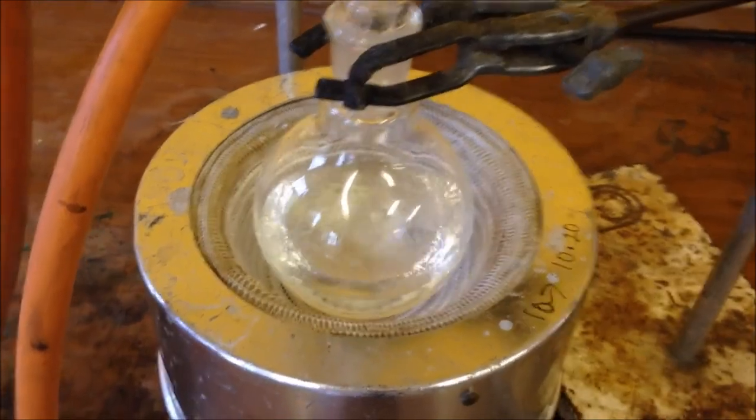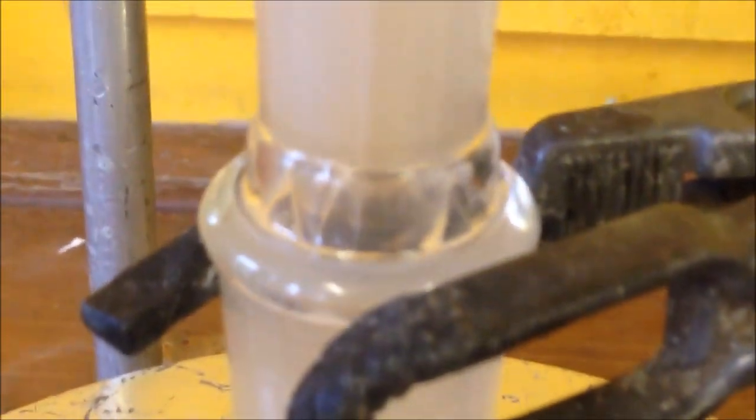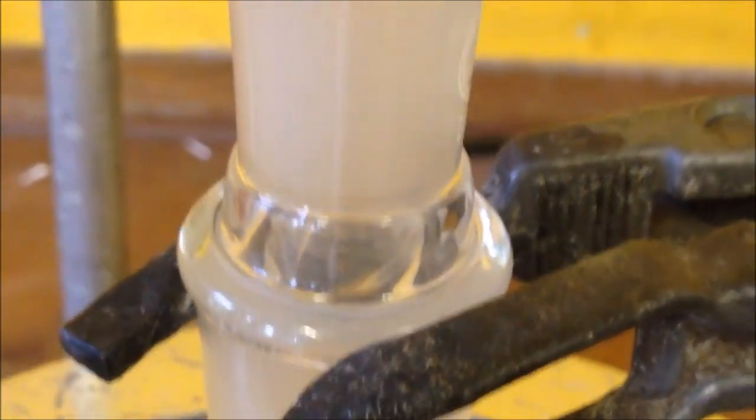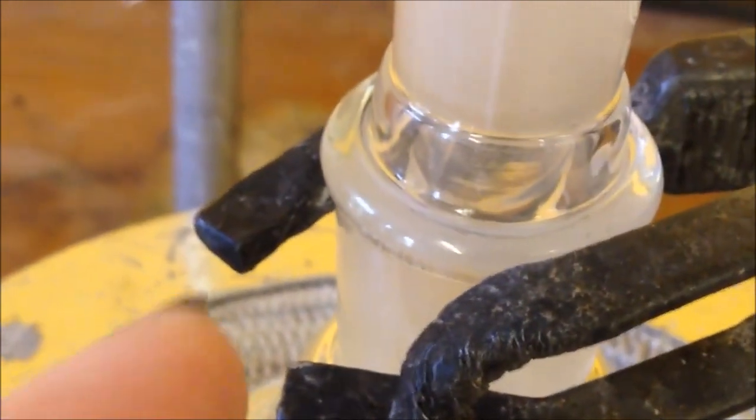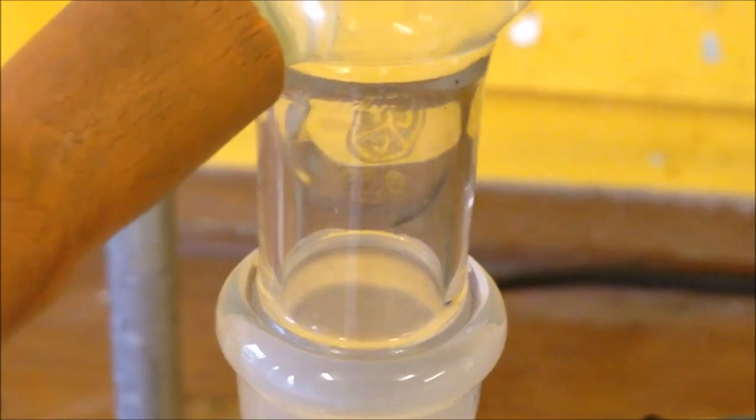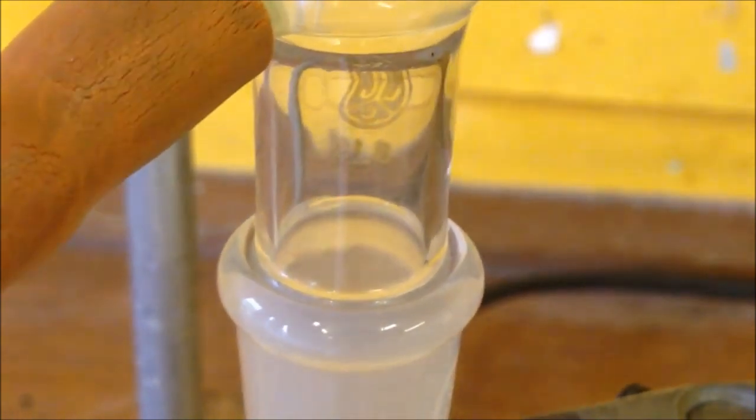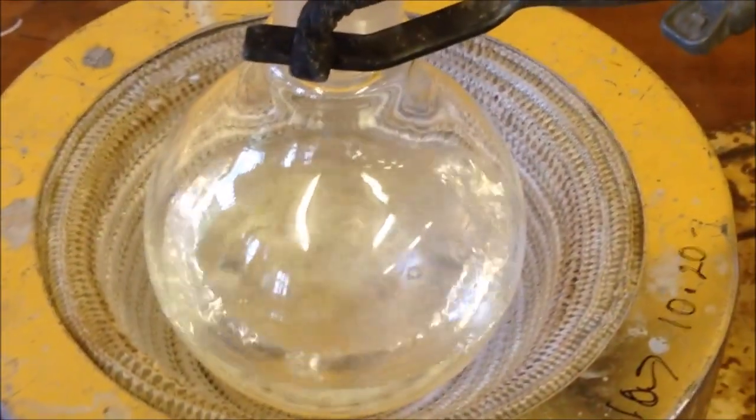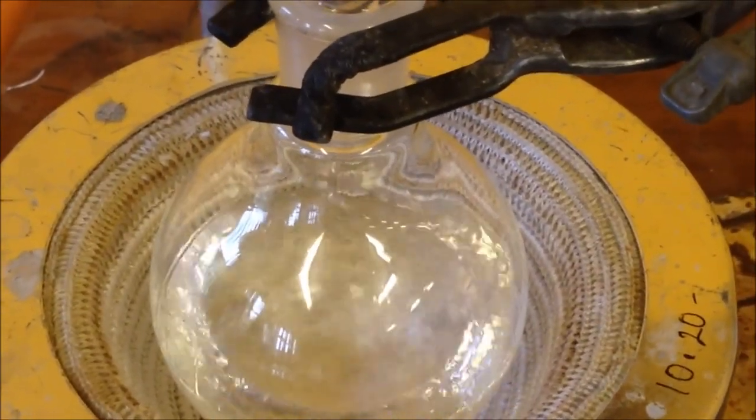So we can see this is bubbling away now, and if we look really carefully in here, you can see it's evaporating and it's condensing. You can see that the cold water is causing anything that's evaporated to condense and then drop back down into the flask where it can be re-boiled. So reflux just lets the same things be re-boiled over and over again.